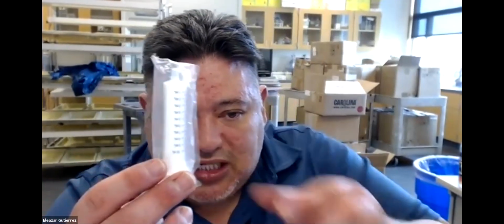Okay, so what does that mean? Remember, you're gonna pull this in a vacuum. You're gonna pull in a vacuum, and then that's gonna take the gas out of the leaves, and they're gonna push it up. You're gonna fill it up with a solution. You're gonna pull in a vacuum, and essentially you're gonna keep on doing that.